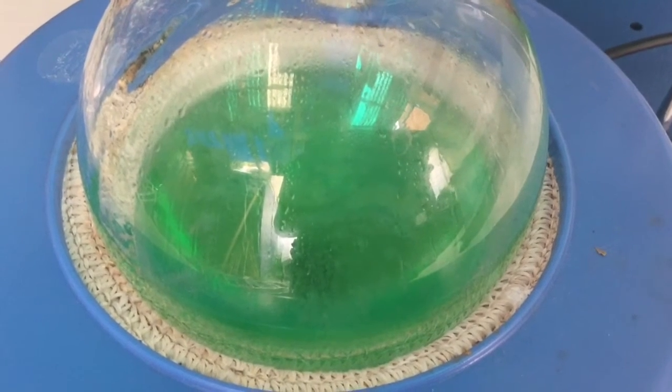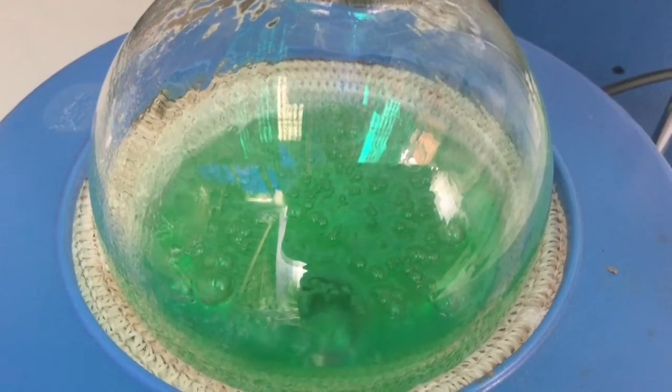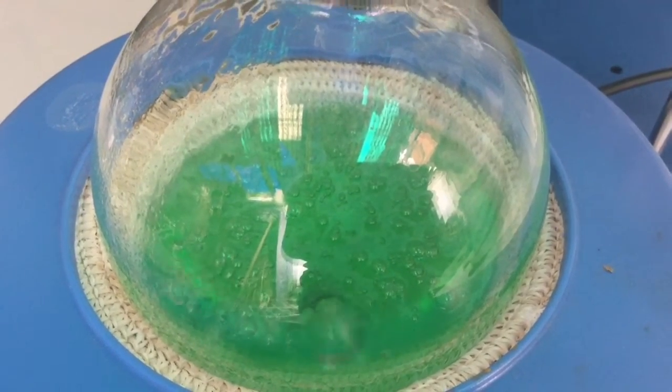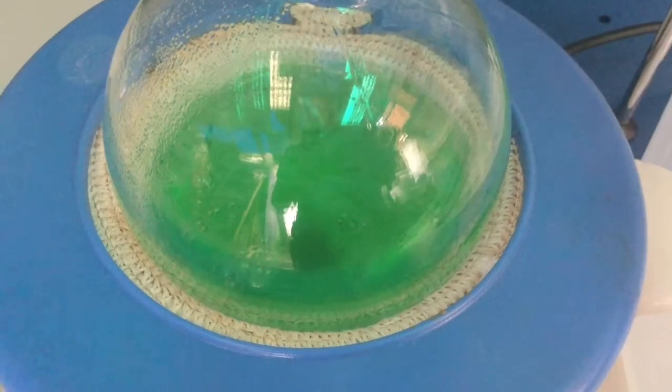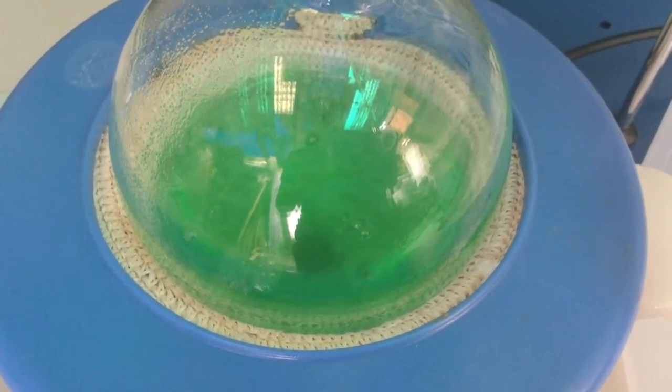This is what the mixture looked like after about 5 minutes of heating. And this is what the mixture looked like after about 10 minutes of heating. And this is after around 20 minutes of heating what the mixture looked like.